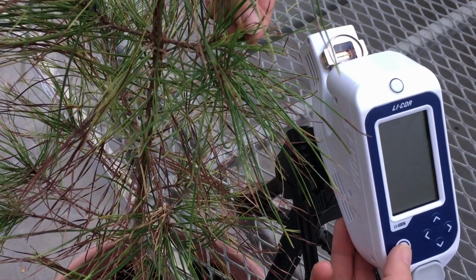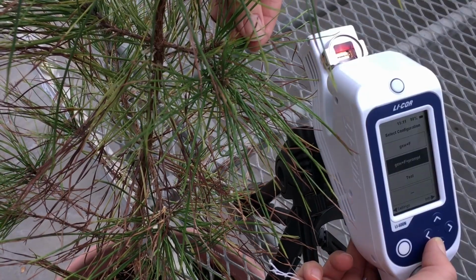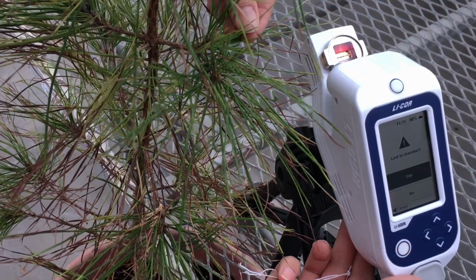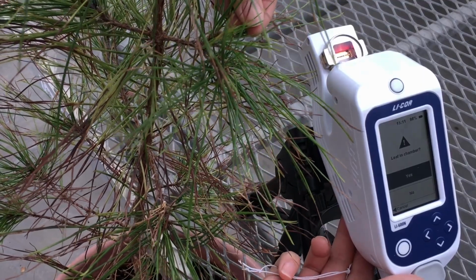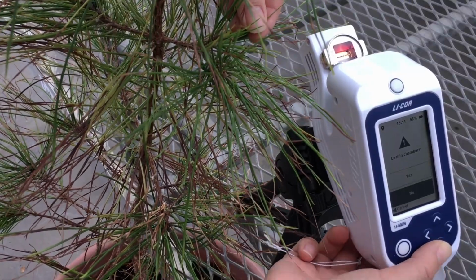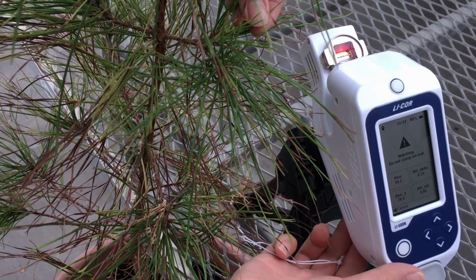Okay, now let's power on the device. We need to pick a configuration to use. We will just use the new configuration we just created, and then press enter. The auto matching will be triggered after a new configuration is picked, so you just follow the question. For me, leaf in chamber, my answer will be no, and then press enter. And the matching is going on. It will take just a few seconds.